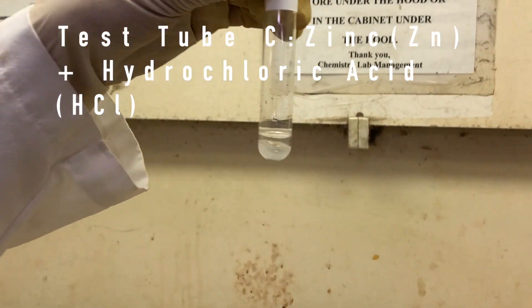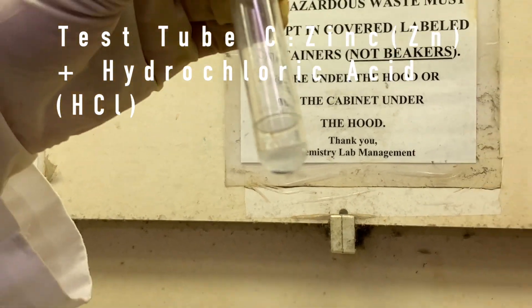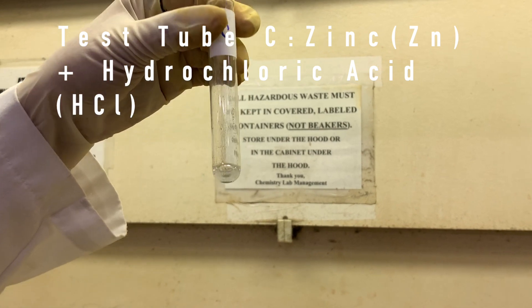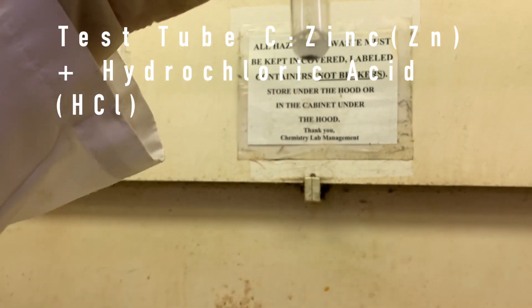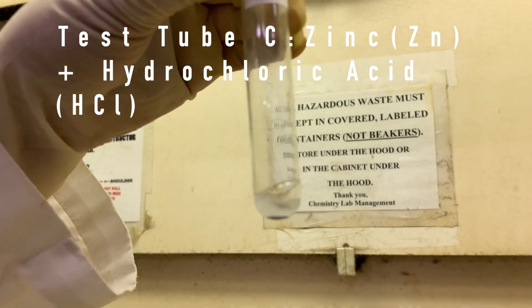This is zinc with hydrochloric acid. If you look at the bottom, you can see the effervescence and the bubbling.